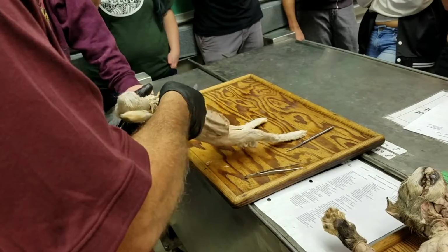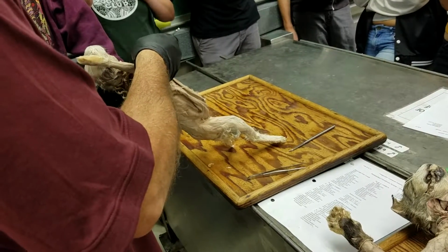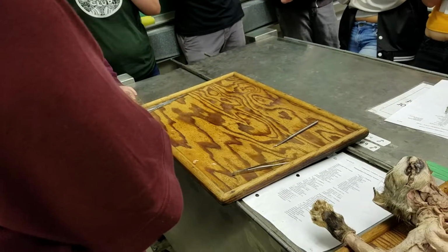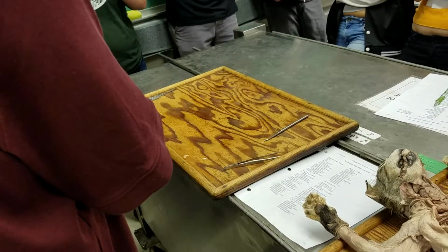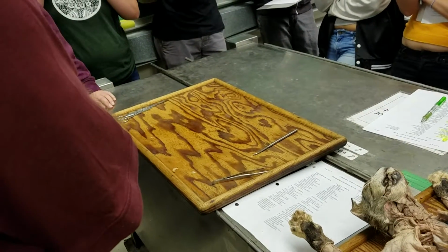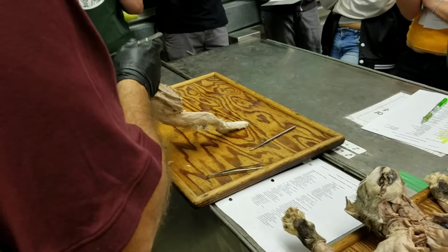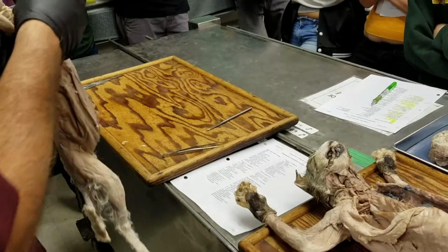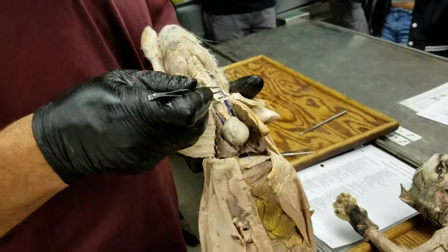So coming back to the rabbit, that's cranial vena cava. The subclavian comes in from the limb, and then the remaining vessel coming down from the head is the jugular. And technically, there's a little short segment that may or may not be present called the bijugular trunk, and then the internal and external jugular join together to form that bijugular trunk. Mostly what we're seeing here is just external jugular coming down, which is the bigger one. So this is external jugular vein here joining up with the subclavian.